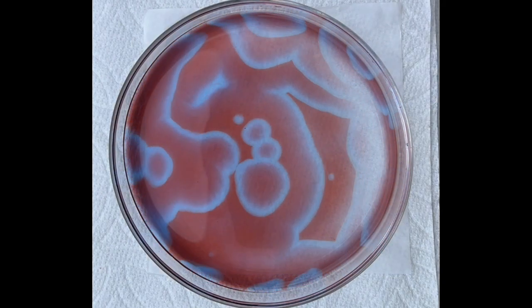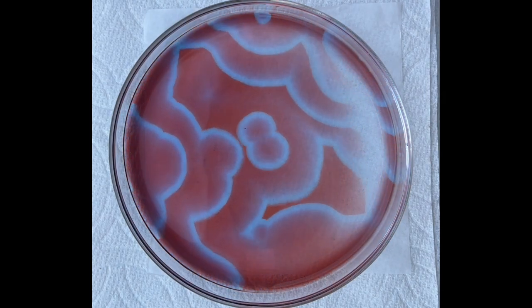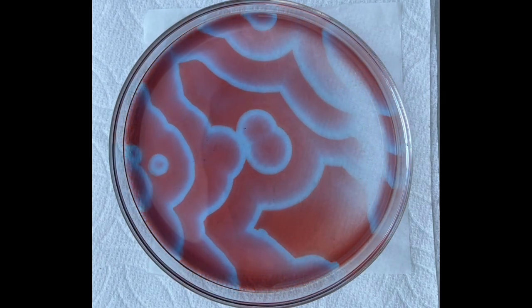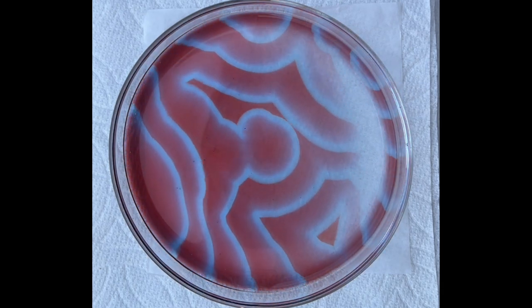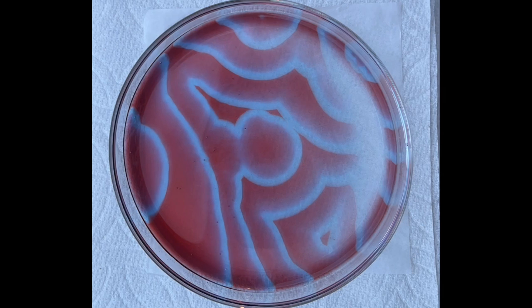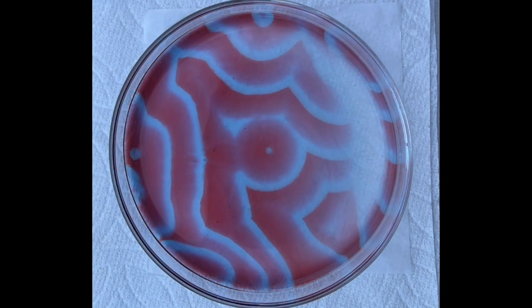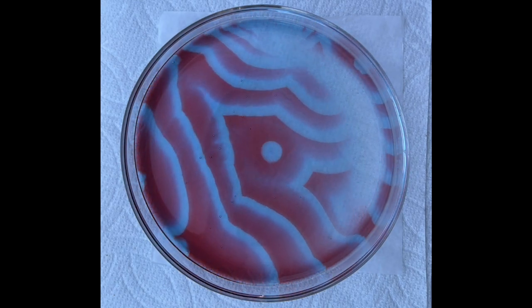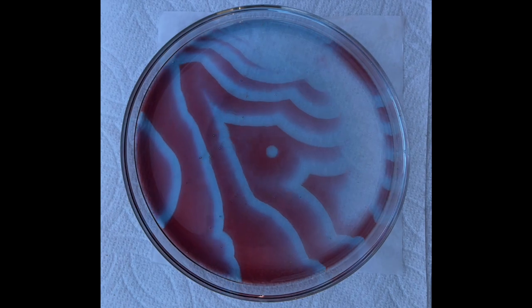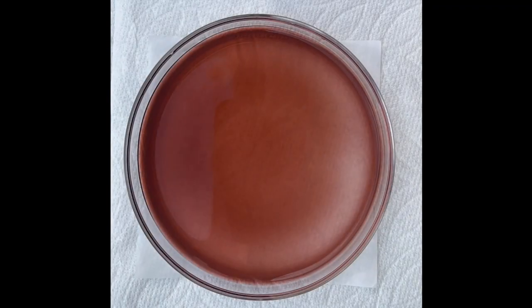Compared to the reaction without cerium, my first observation is that the color contrast between waves have become more pronounced, presumably due to the yellow color of the cerium 4 ions. The waves appear to be thicker as well, although in the previous runs without cerium, some waves appear to be thick too.